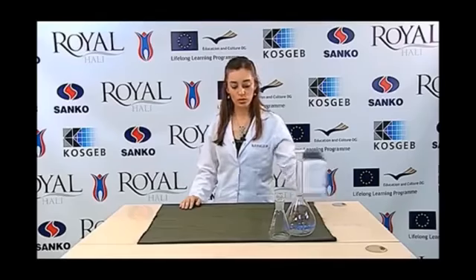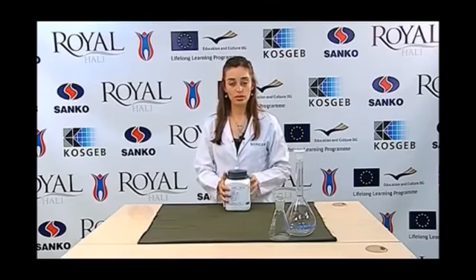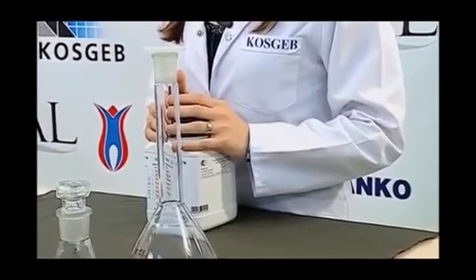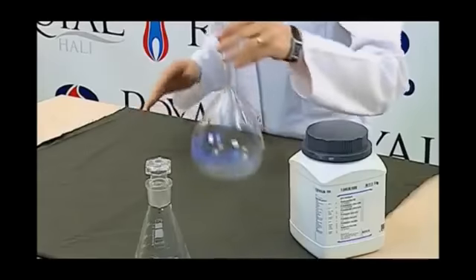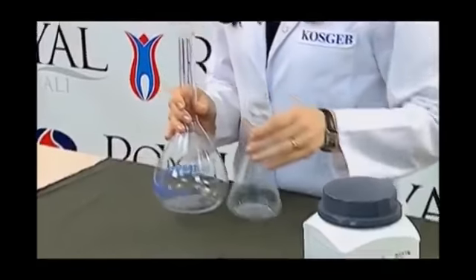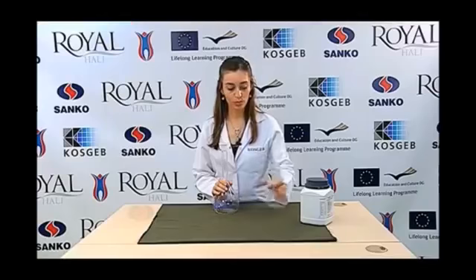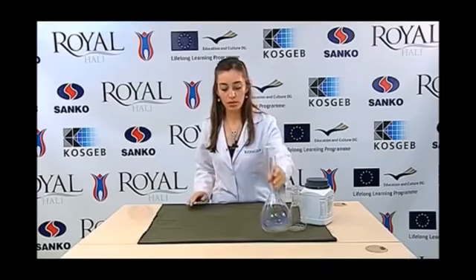During the progress of our test, we use a mechanical shaker. Besides this, we use some potassium chloride solution. The potassium chloride solution should be at 0.1 molarity. We use a precision balance, a pH meter, and buffer solutions for the calibration of the pH meter. Various glass materials for the preparation of our solutions are used. The samples are shaken, and of course we use distilled water in the preparation of the solutions.